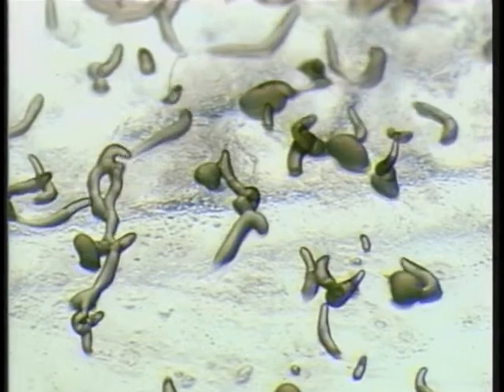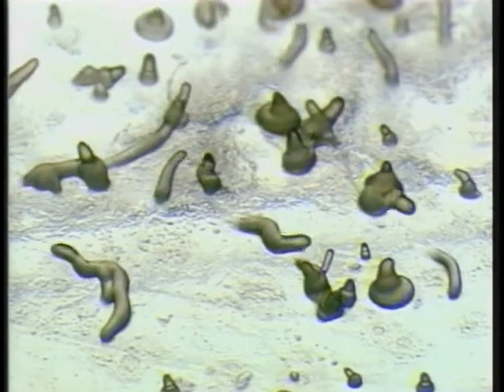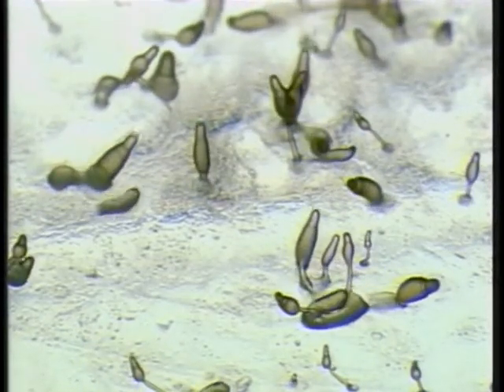The slime mold produces long stalks with fruiting structures at the tip. The cells at the tip transform into thick-walled spores, which are released, and upon germination, release myxamoebas. This was filmed over about 1.5 hours.